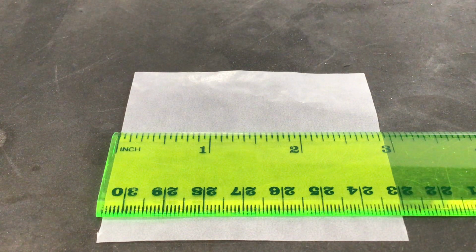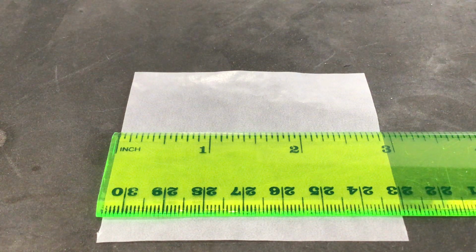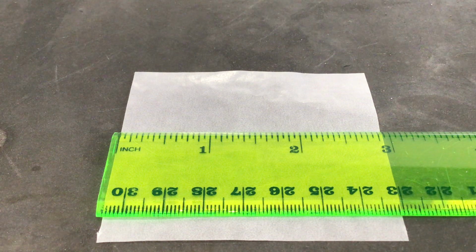Now, in the actual lab itself, as you're making your measurements and recording them, you might end up reporting something like 1/16 or 3/16 of an inch, and we're going to have you write that out to 4 decimals just to give some inches to centimeters comparisons. But do be aware, that's not really accurate in terms of sig figs. Sig figs are much easier to express in the metric system, where our rulers and measuring tools are calibrated so we can read them and write down an actual decimal number from what we visually see. That's much more difficult to do with the inches measurements.